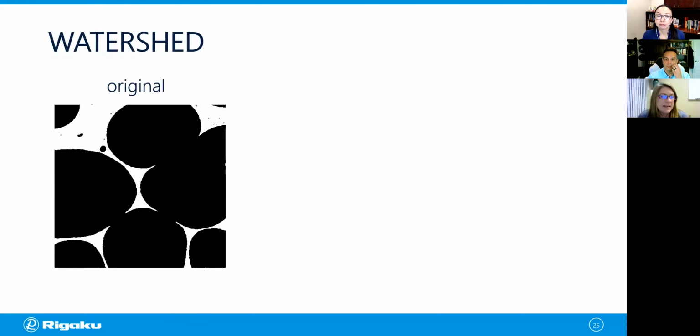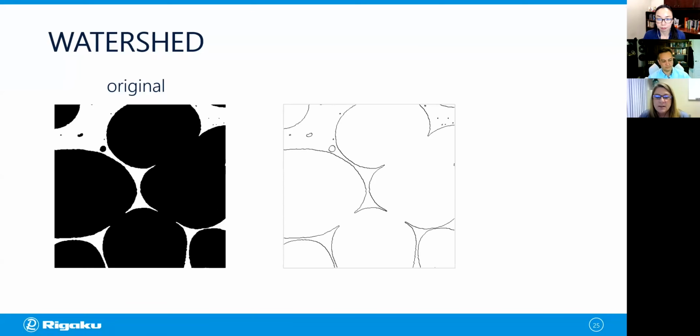Okay. So let's say that we have this original foam image in this case. What we want to do is to separate each of the voids to extract some quantitative information about them. If we just look at the borders and how the software might see them, then we see here that we have one void that actually is a combination of 3, because they're all touching. But what we really want to do is separate or split these objects apart by these, say, red lines. And we're going to accomplish that by using an algorithm known as watershedding.